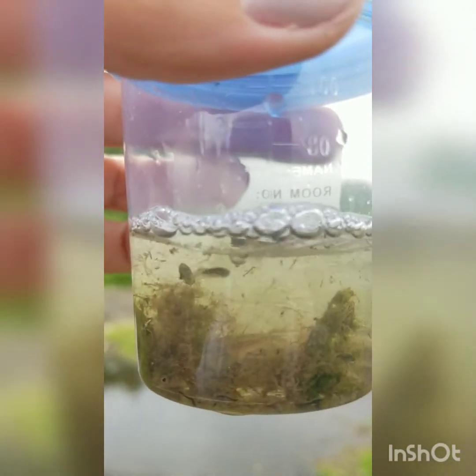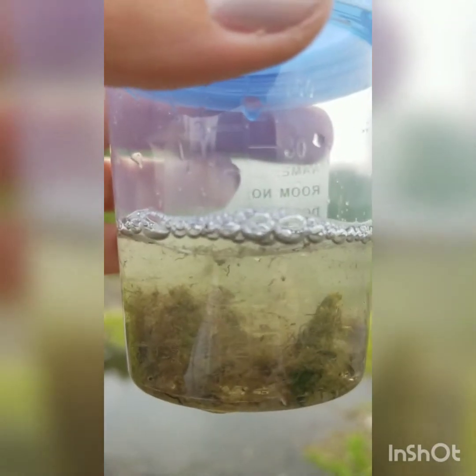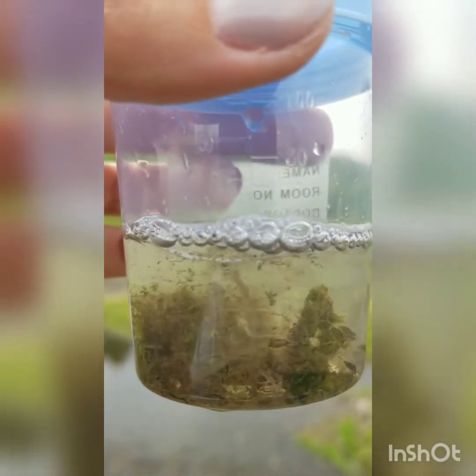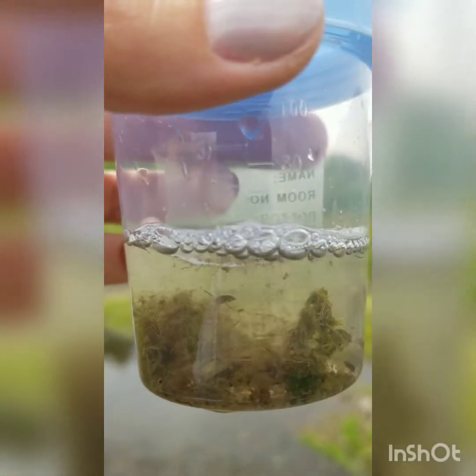Okay, so I couldn't use my phone while I was pouring them into the vial, but I've got everything stored in here now. You can see a couple little fish in there, and some Corixidae, which are water boatmen. Those are the ones that are moving around pretty quickly. I'm sure we've got a whole bunch of other stuff in there, but we'll go through this using a microscope and count and identify everything, hopefully down to family at least, if not species.